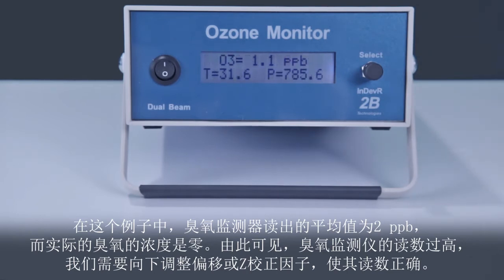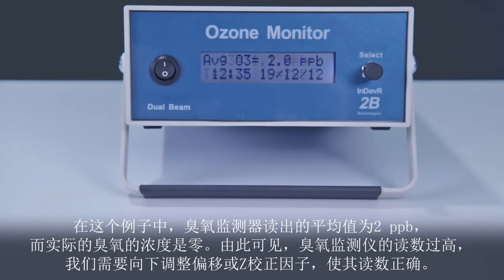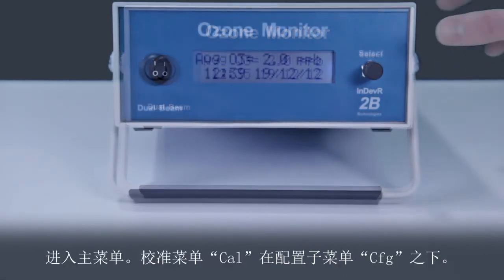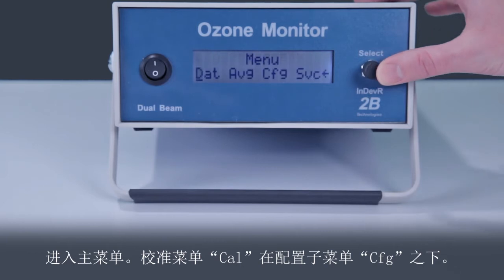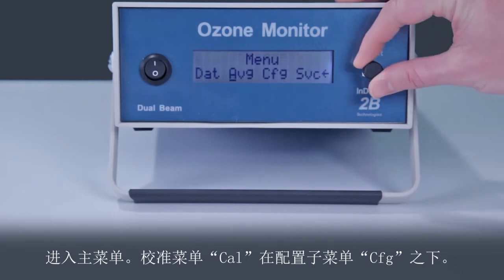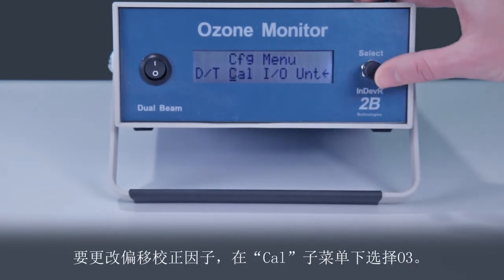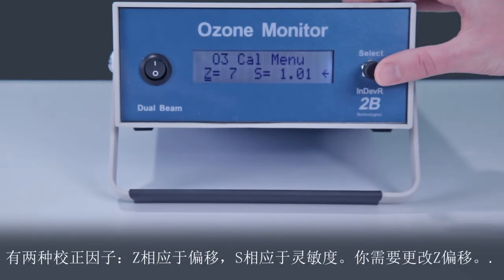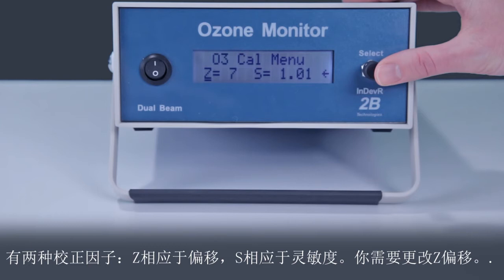So the ozone monitor reads high, and we need to adjust the offset or Z calibration factor downward by 2 to make it read correctly. Go into the main menu — the calibration menu is under the configuration. To change the offset calibration factor for ozone, select O3. There are two calibration factors: Z for the offset and S for the sensitivity.